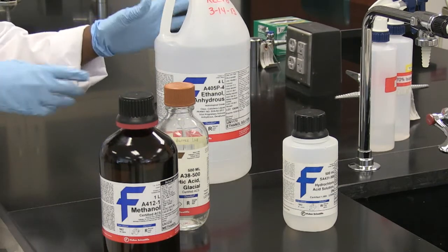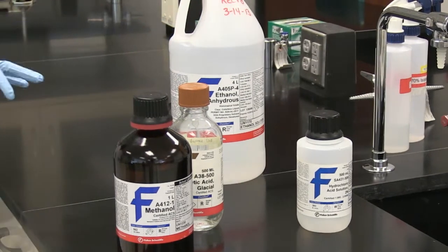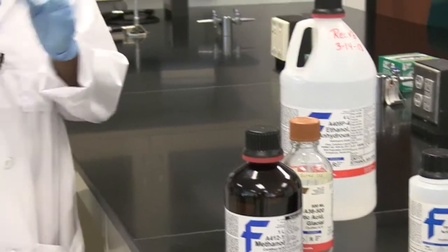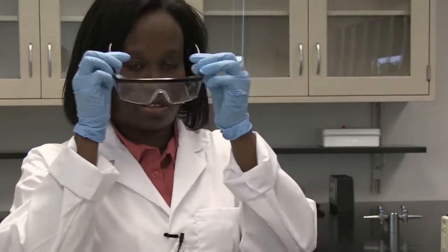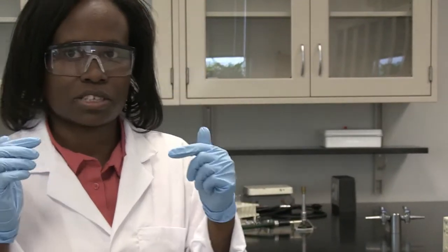When working with chemicals like these, you need to always protect yourself. You need to have on your gloves and your glasses to protect yourself.